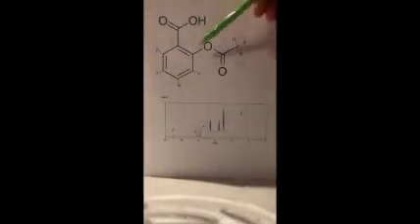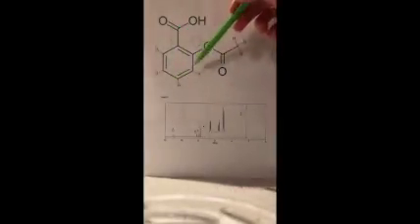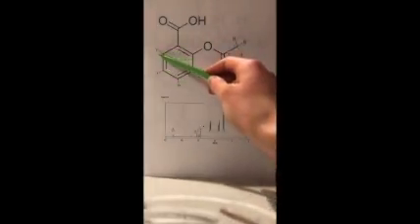It may be slightly confusing to know why these 4 aren't generating the same signal, but it is because of these 2's proximity to the other functional groups in the compound. Because there are these oxygens present, it's going to pull the electrons away from those nuclei, which is going to push them further downfield, as we explained in the previous spectrum of ethanol. So, like I said, these 2 are going to be equivalent, and then this one's going to generate its own, and this one's going to generate its own.